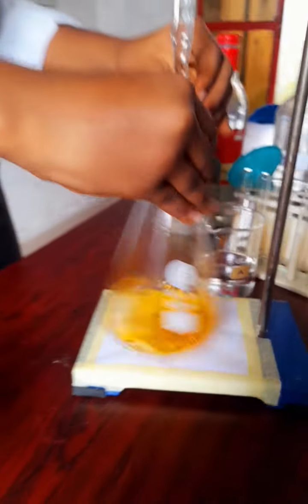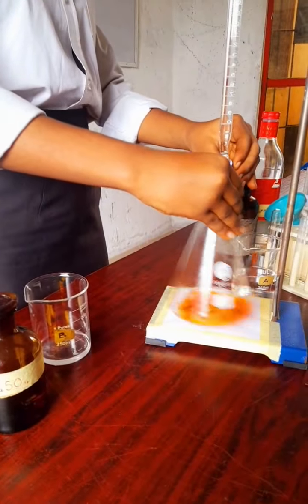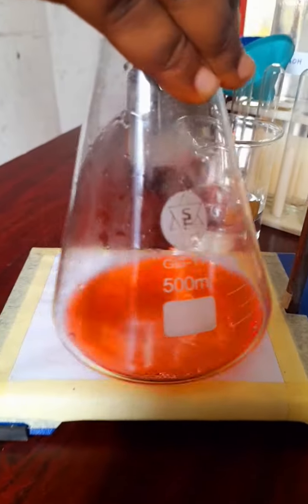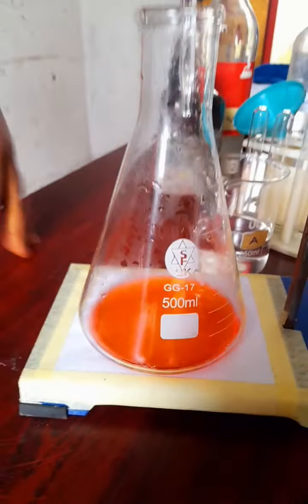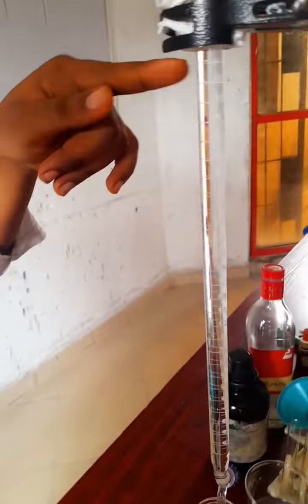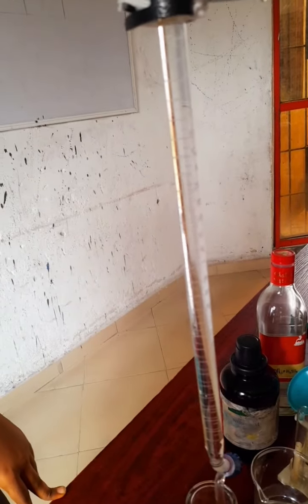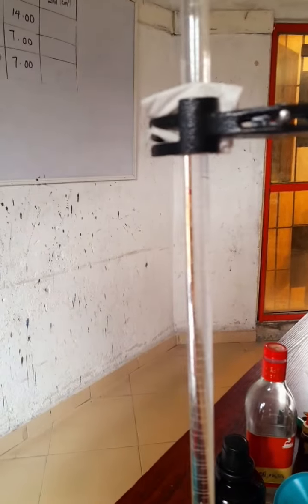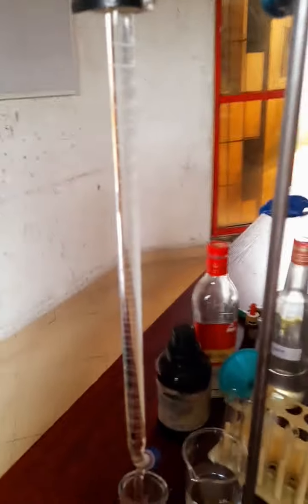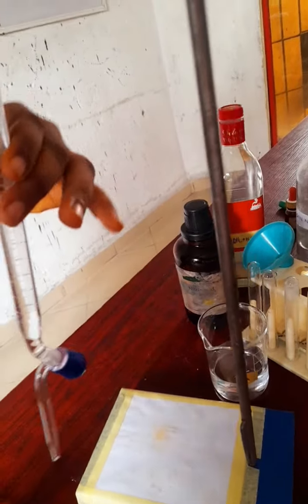So we titrate for the last time and hope that we're going to have what our consistency was before, and see if we added too much or a little more than we should. Okay, let's see how much we've used there. All right, the position where we should read the burette from is where the clamp is holding the burette. So we have to adjust the clamp so we can see the level of the acid.